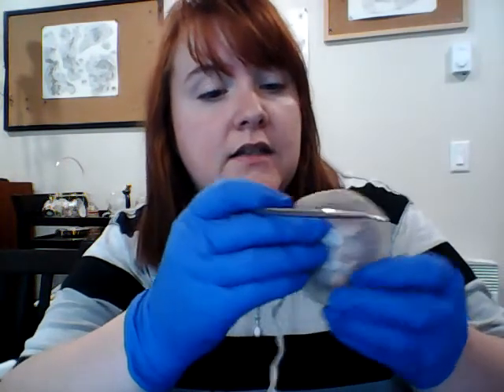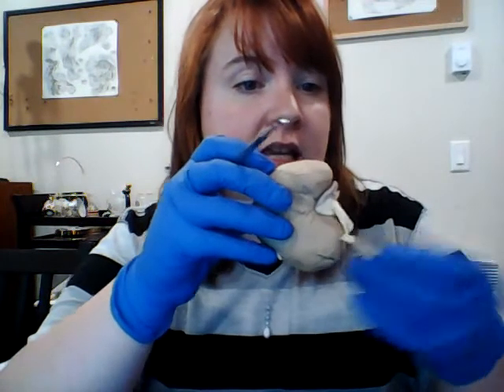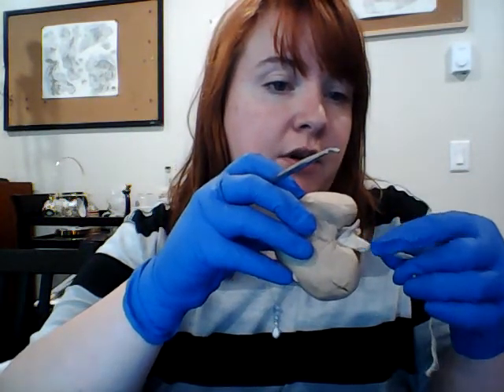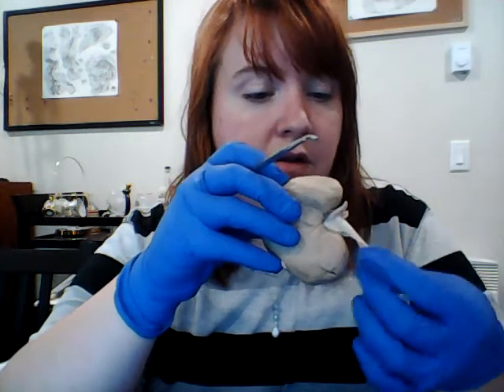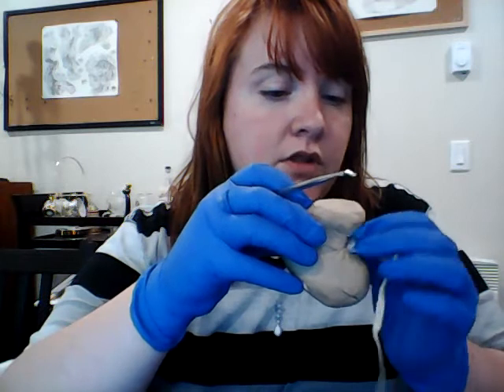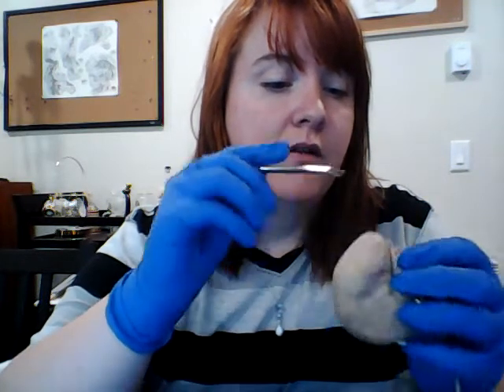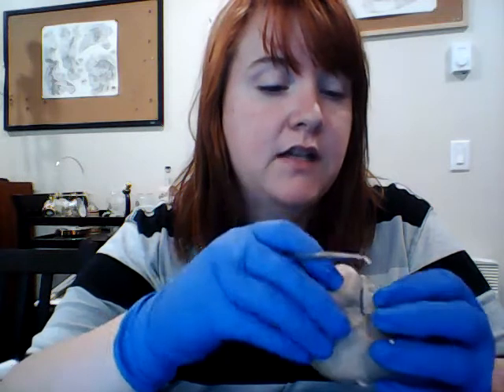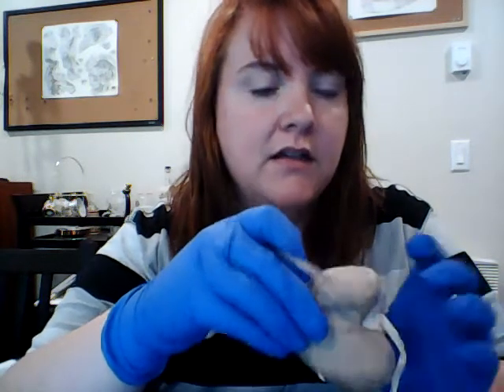So it looks like if you were to have your kidneys like this, you've got the superior portion of the ureter here. It would go down like this and down the rest of the body cavity. So just to recap really quick, oh, and really cool, the veins and the arteries are all right here too. That's not part of the video, but I thought it was neat.